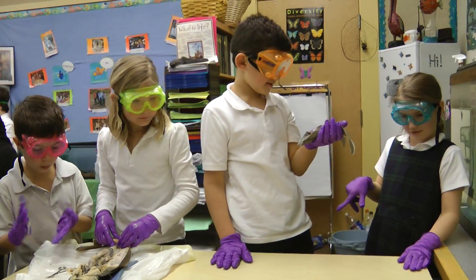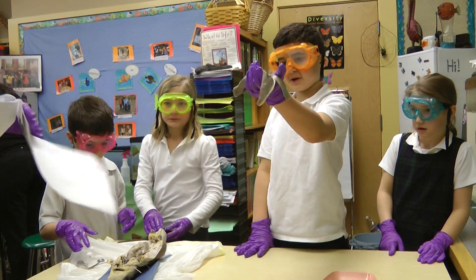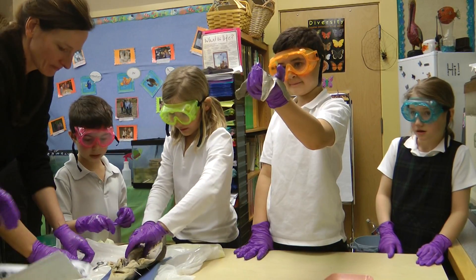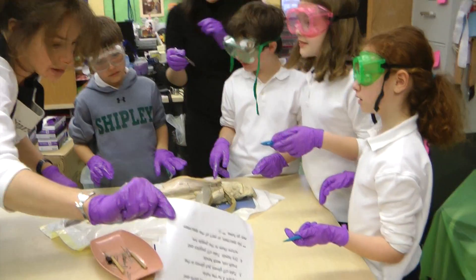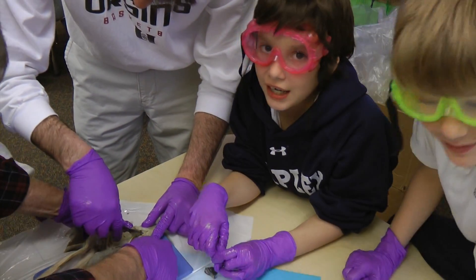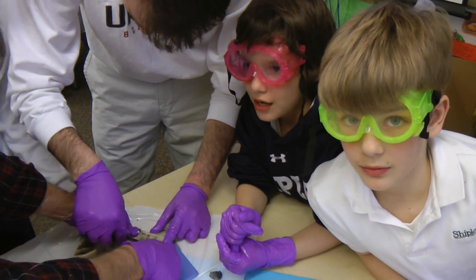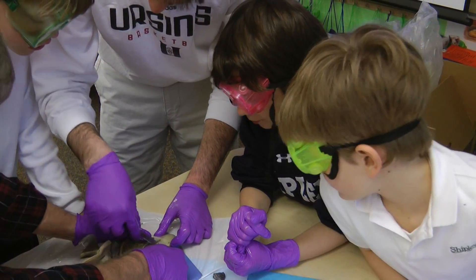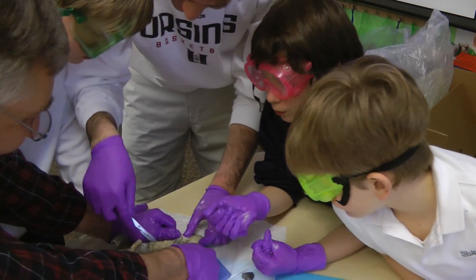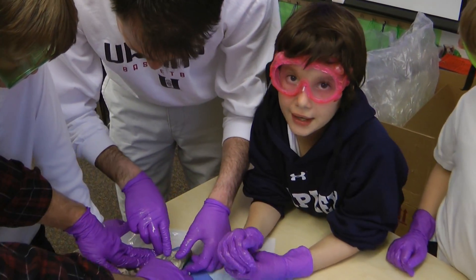This is the liver. We need to find... cut up the stomach. This is our liver. What about the brain? We're just digging away from the brain now. Right now we're looking for the brain. It's really difficult because we can't find it. It looks impossible because it doesn't look like we can cut up any farther.